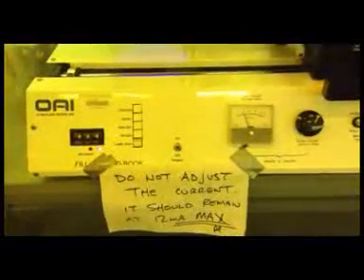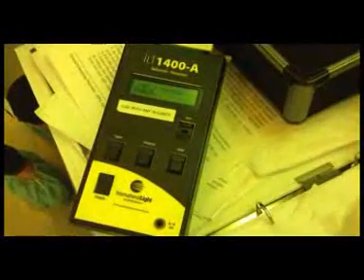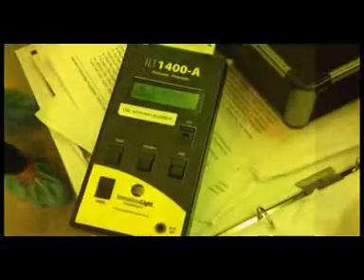While you're letting it cool, half an hour should have passed, so you can turn on the aligner. First, we need to test the energy level of the lamps for the day. Take the photometer and place the sensor blue side up on the stage. Then set the expose time to 2 seconds. Turn on the photometer and pull the stage over to expose. Keep your eye on the photometer and record the highest reading and outputs. Record that in the logbook.